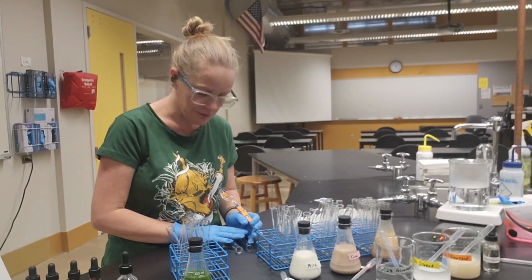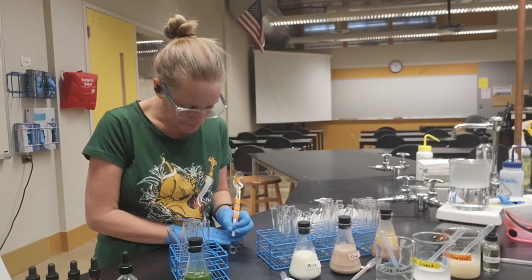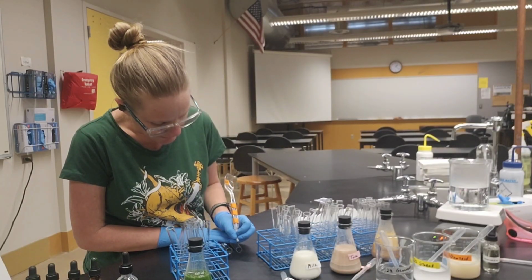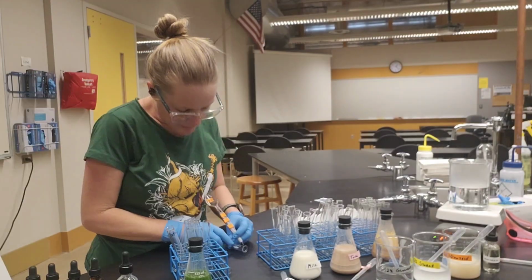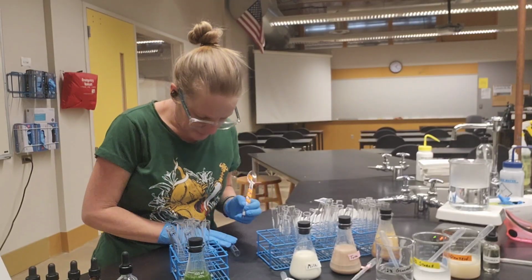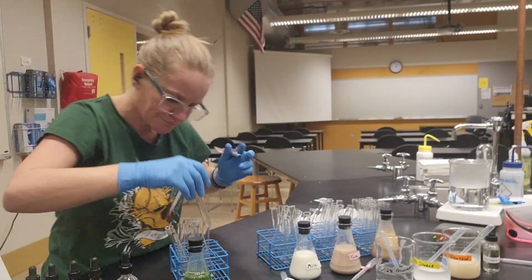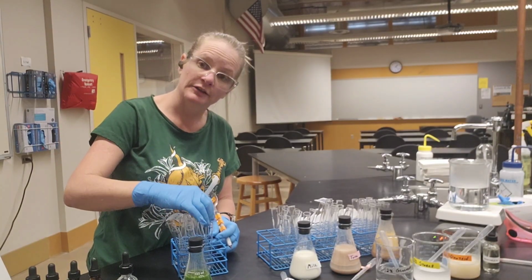Okay. This first set, what I'm going to do is I'm going to label SS for simple sugar. And I need a positive control. So I'm going to indicate that using a little plus sign here next to my SS. All right, this one's going to be a negative control. And this one is going to be my experimental group, so I'm going to write an E on that one. I don't know if you can see that. Okay. So now I have my simple sugar positive, my simple sugar negative, and my simple sugar experiment.